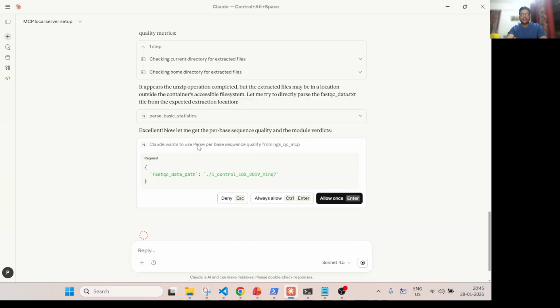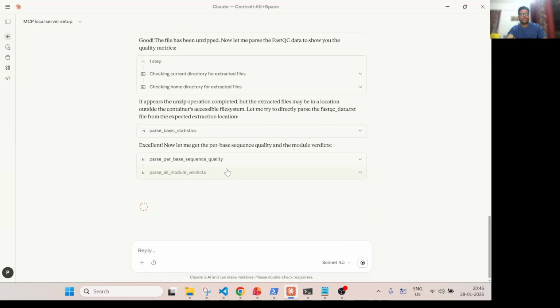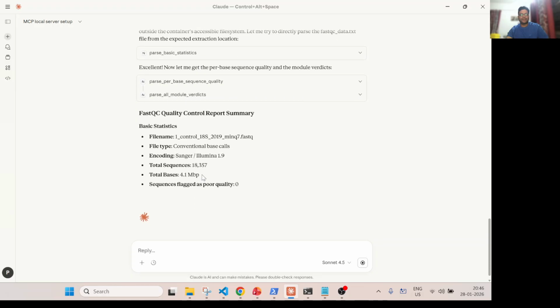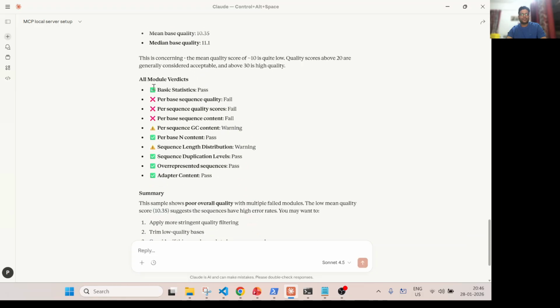Now it tries to run the other thing. What function is it calling? It tries to call the parse per base sequence quality function. Okay, so now it tries to call the all module verdict. So it's the third function. Okay, so again you can allow it. So finally it gives me the entire summary, right? Like the file name is this one, total sequences were this one, total base pairs, and overall per base sequence quality was fail, 10.35 like this, and this is the overall verdict. Okay, so this I got from this file.